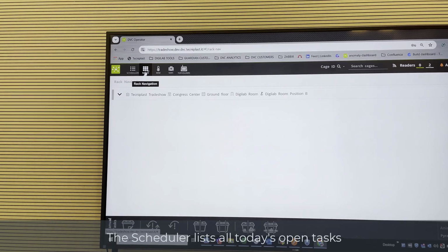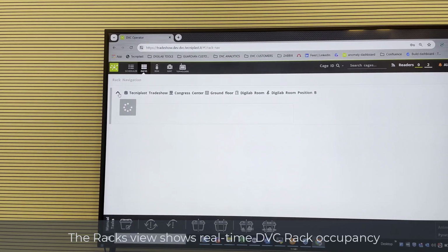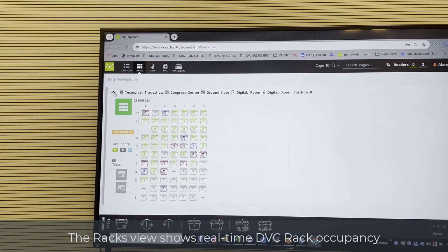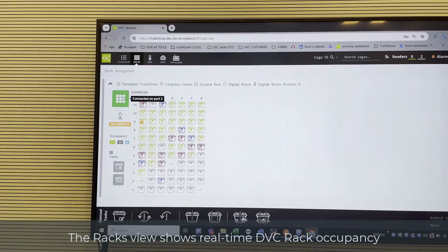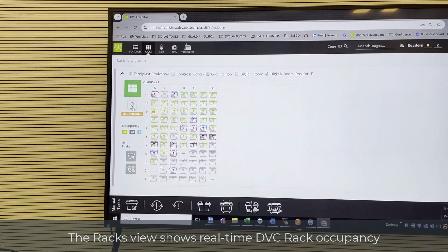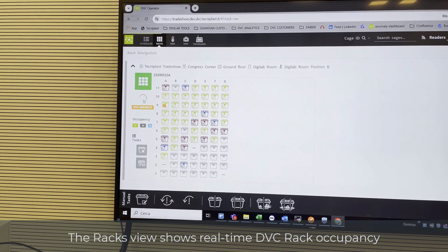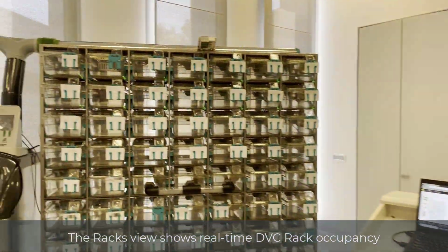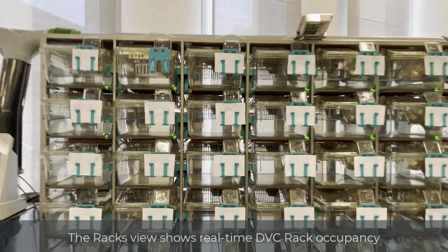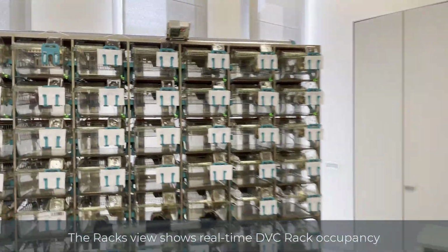Then the second tab is the rack view, where all the connected DVC racks are recapped with the precise location of where they are. This is the DVC rack in real time. You can click the little green light LED bulb, and the corresponding rack is showing the LEDs.